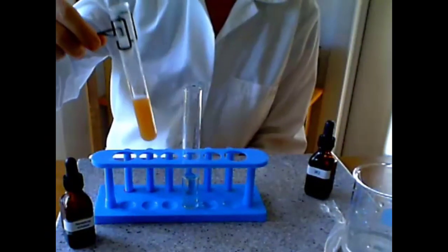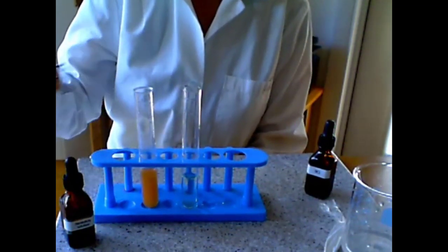Now here you can see the results of the water inside of the test tube.